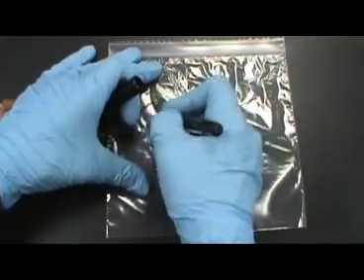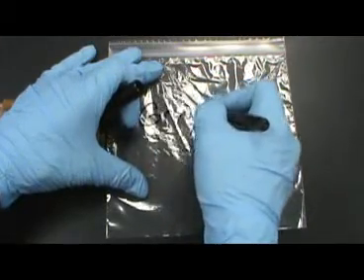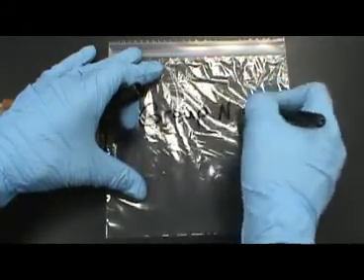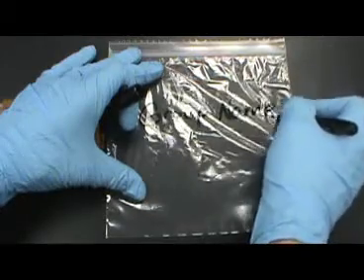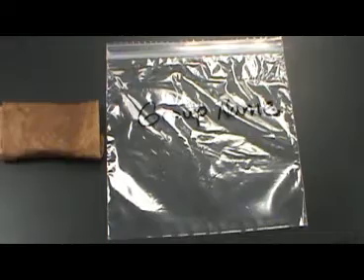Your titer should be stored in a refrigerator inside the plastic bag. If a refrigerator is not available for storage, room temperature is fine.